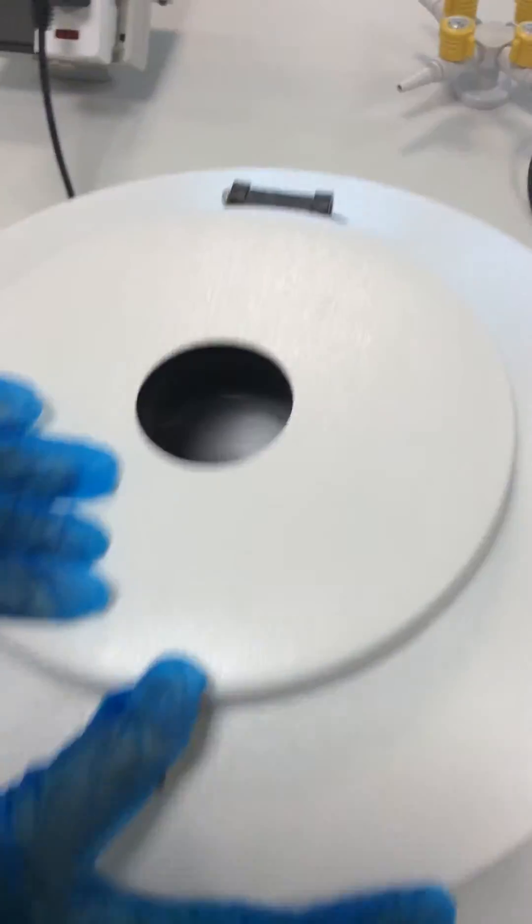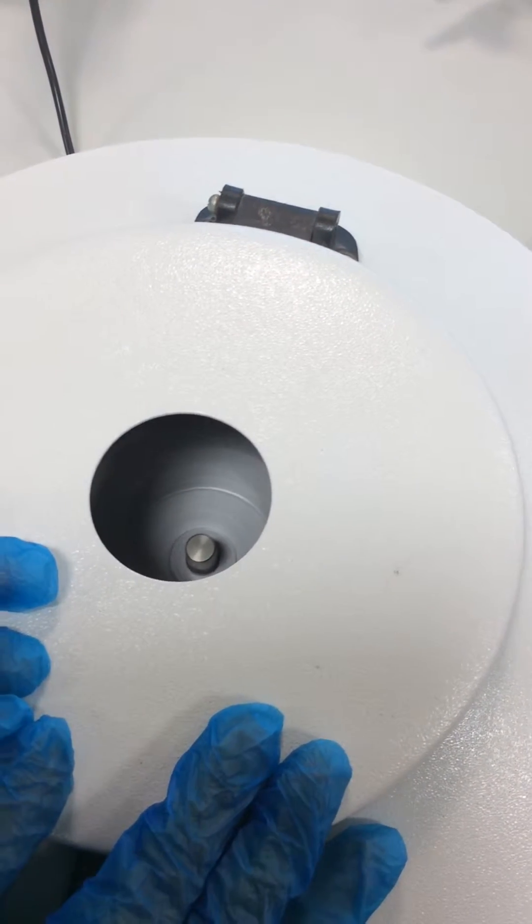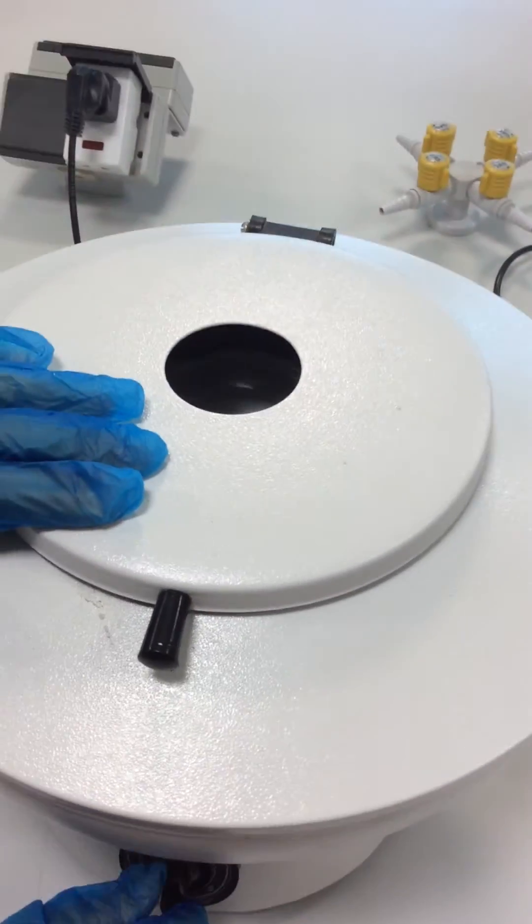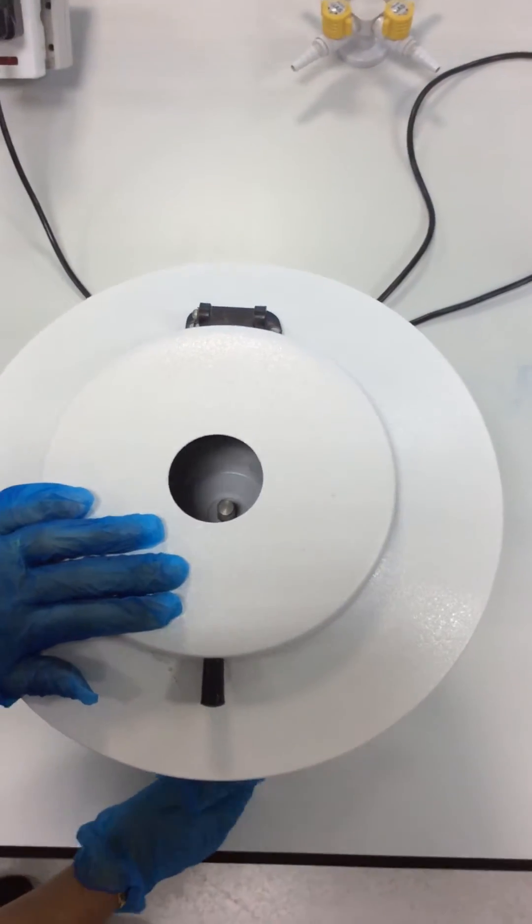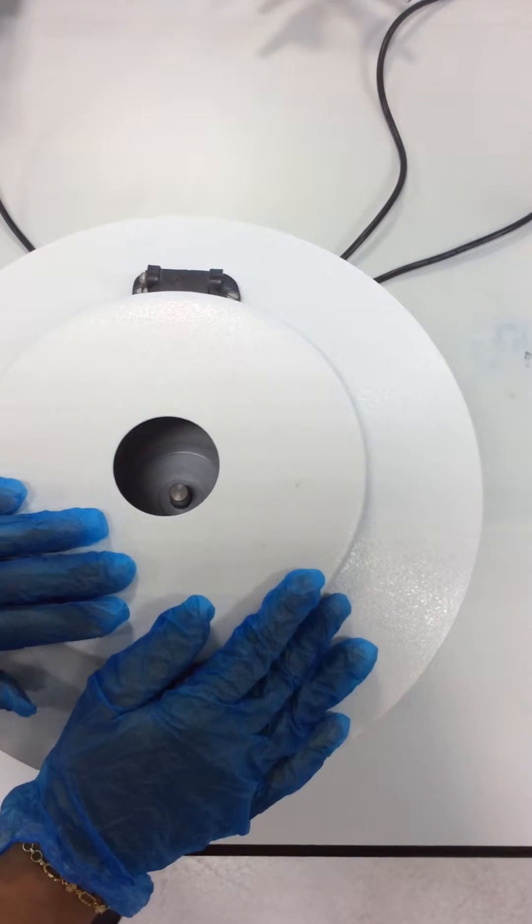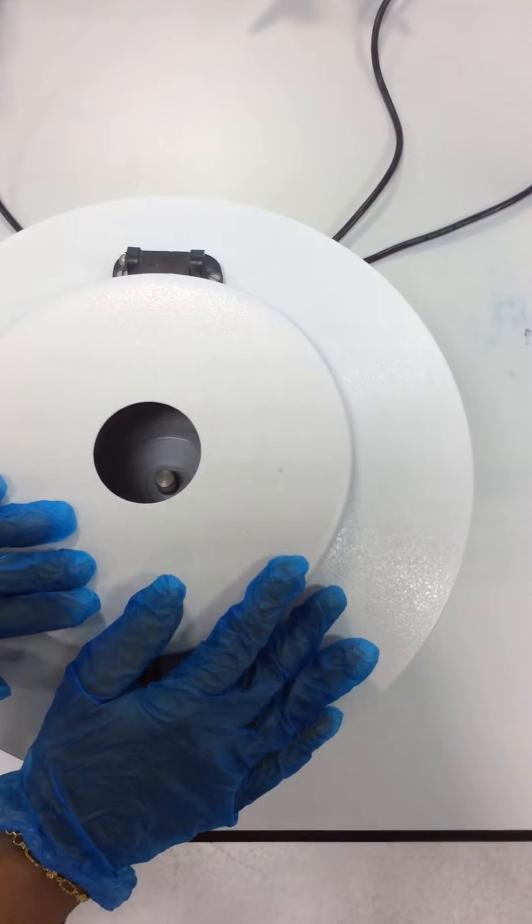Now you can see that the test tubes inside have started spinning at a very high speed. I can increase the speed, and this continues for around 5 to 10 minutes in order to get the best results.